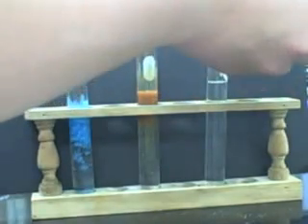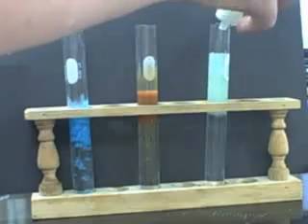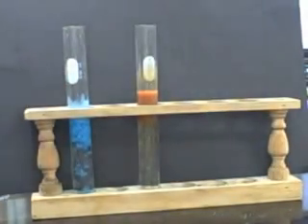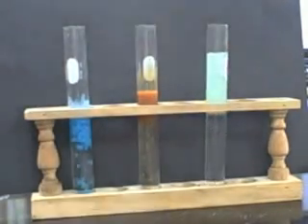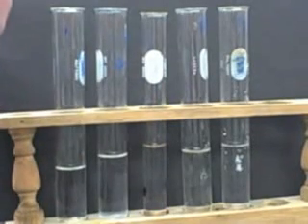You can see our nice precipitate there. So here's nickel chloride and sodium carbonate. Nice light blue-green color there. As you can see, these are similar to the hydroxides. So now we're doing phosphates, and these are actually pretty original. There's not many of those up on YouTube.